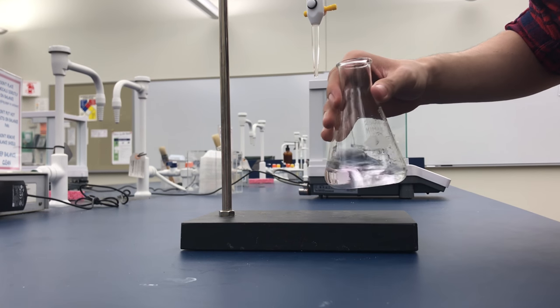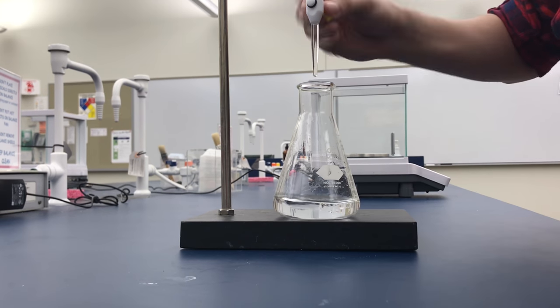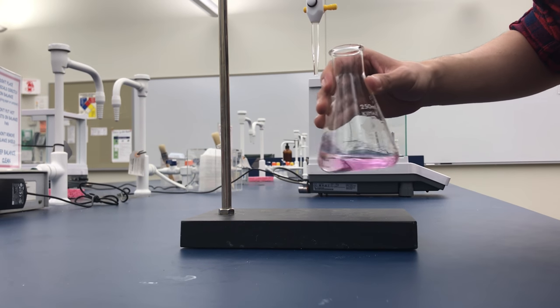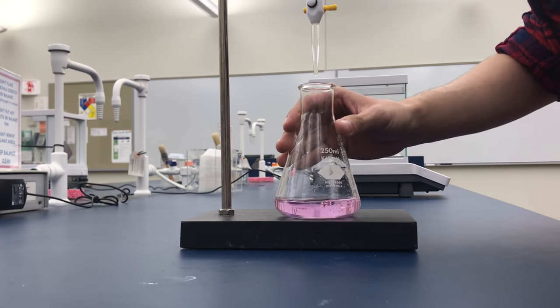The goal of titration is to neutralize the solution. The indicator will have a light tint when the solution is very close to neutral.